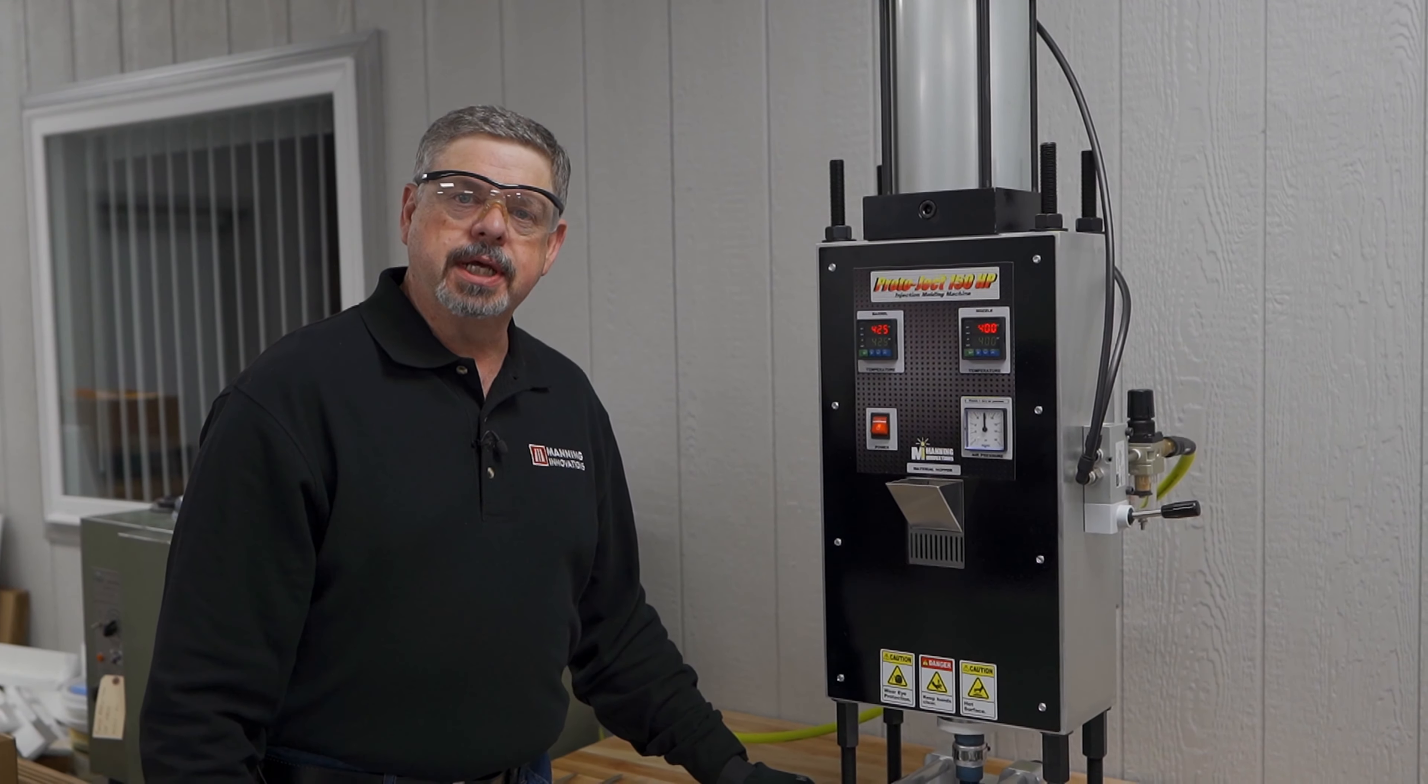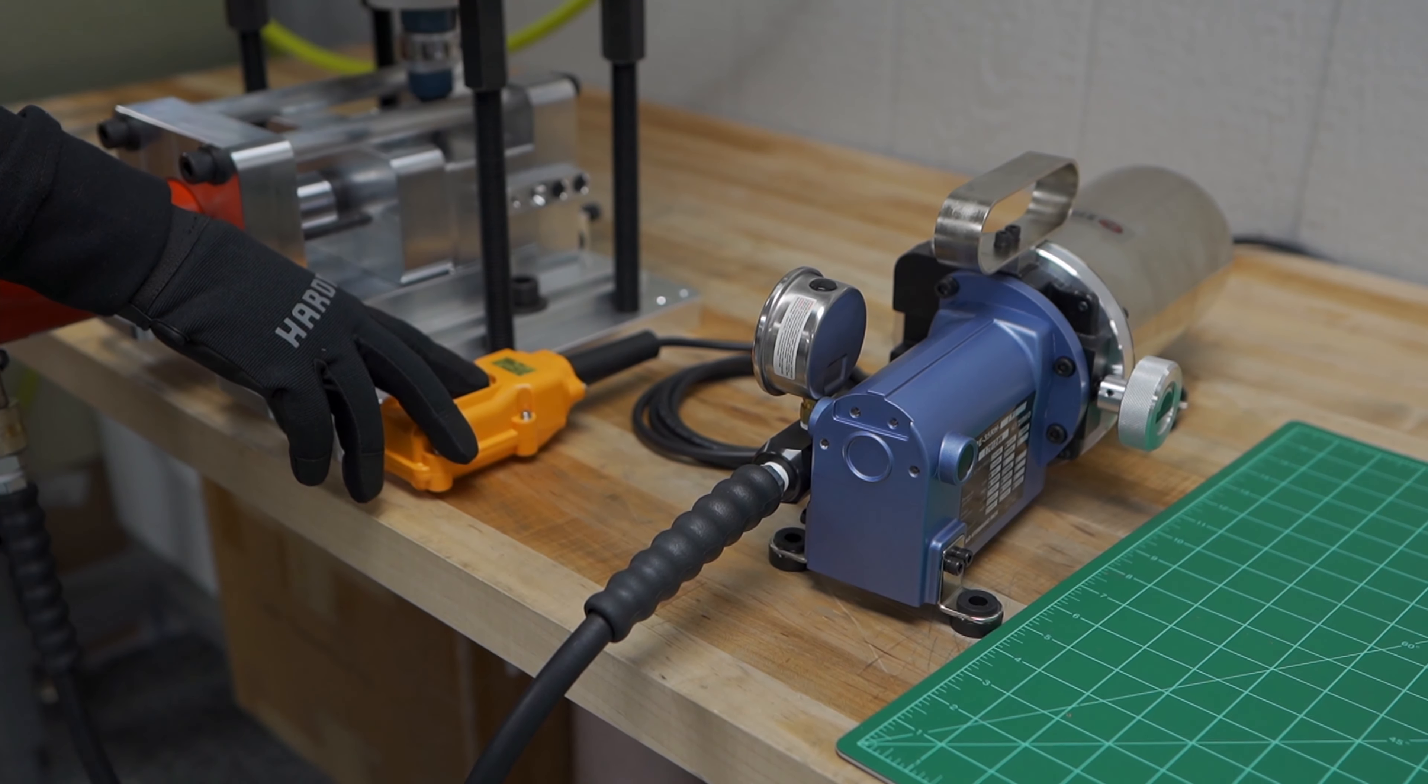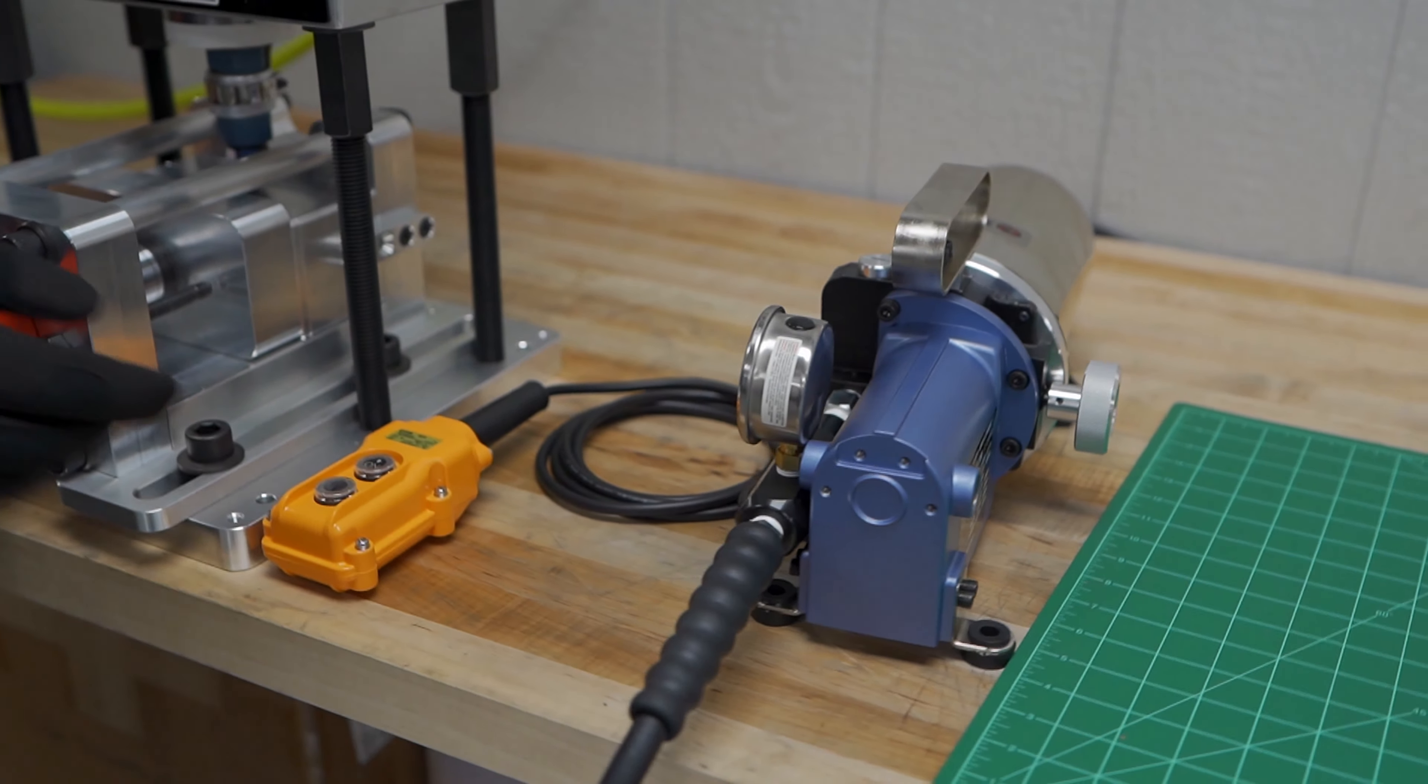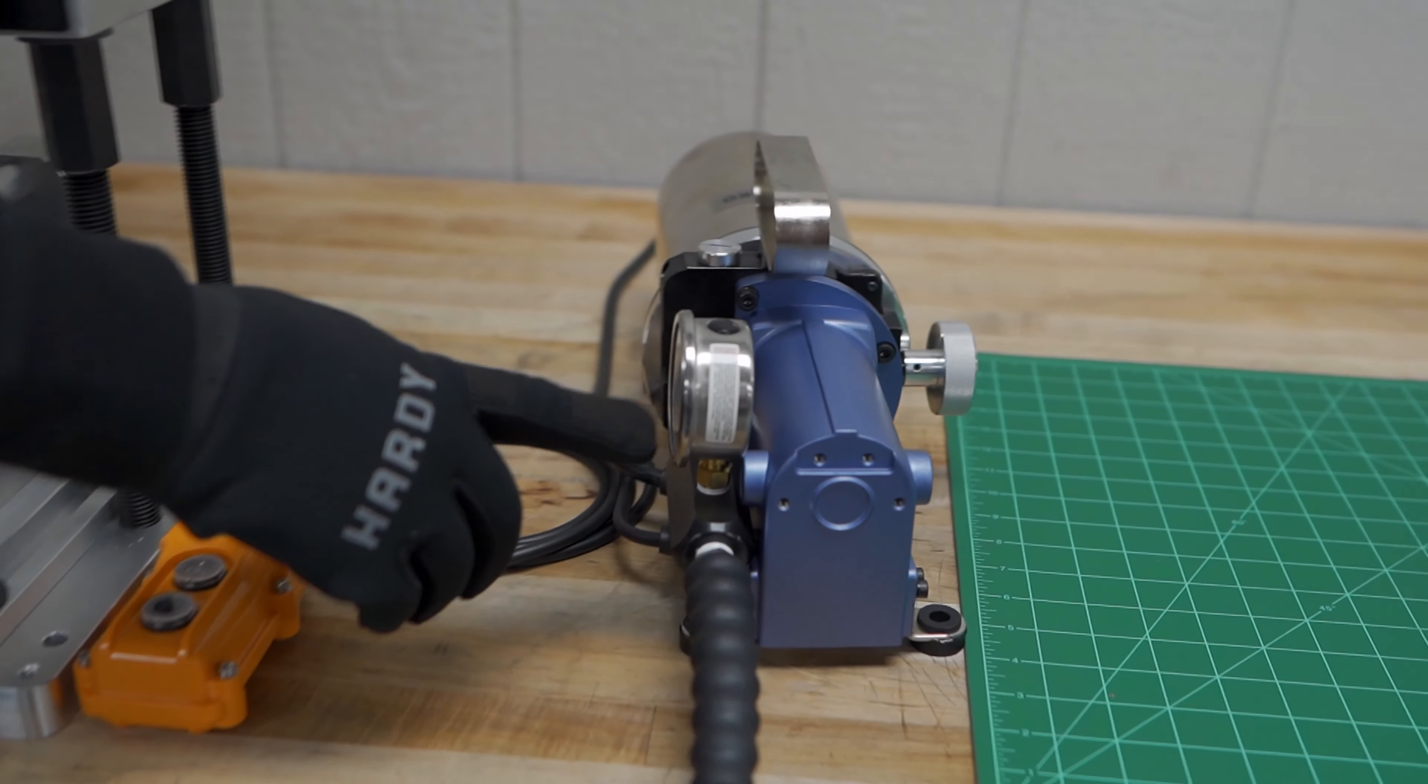We just close the hydraulic valve on the pump, activate the push button, and wait for the pressure to rise. You can tell by both the sound and the visual indication when you have reached 10,000 PSI on the gauge. You're now at your full rated pressure for whatever clamp you're using. Again, in this case, it's the 15-ton clamp.